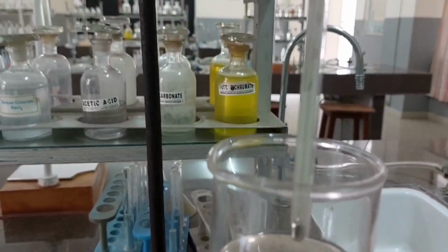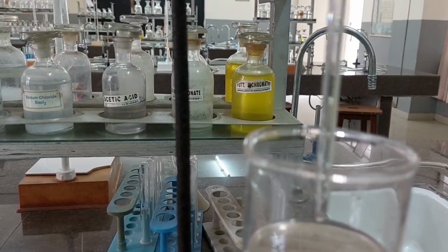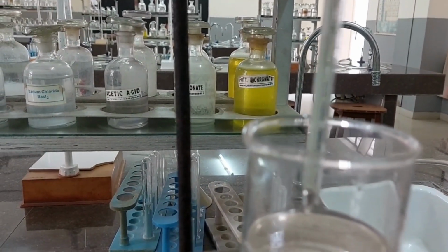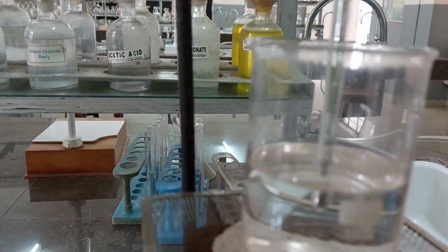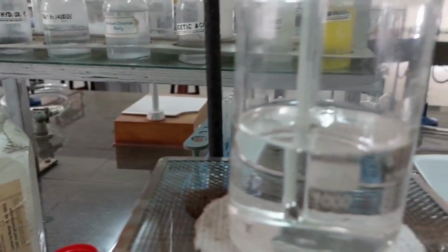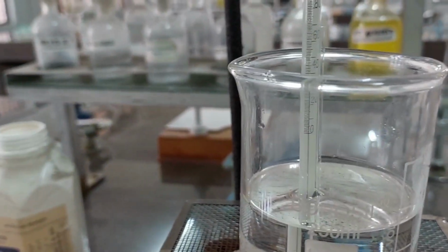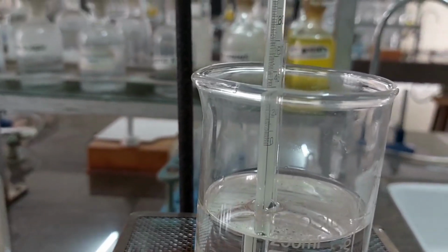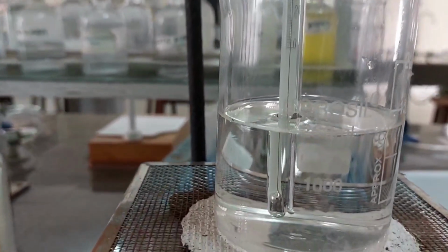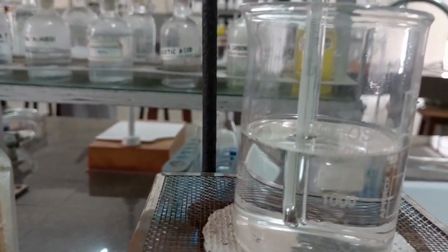See, it is neither fixed with any rubber band nor any thread. It is simply sticking to the thermometer due to cohesive forces. Viscous liquids provide cohesive forces which hold the glass together. This glass holds another due to strong forces.